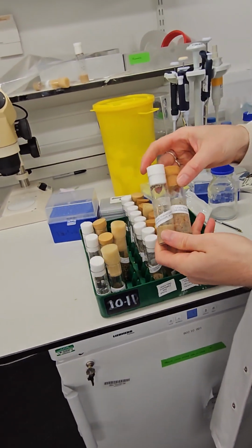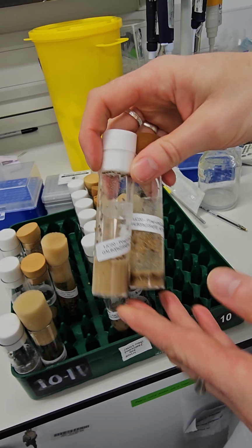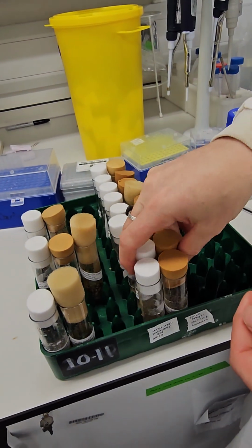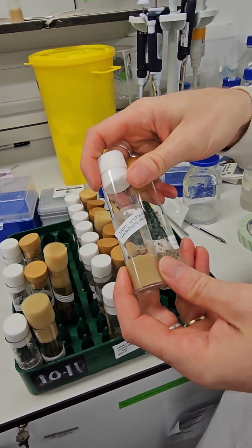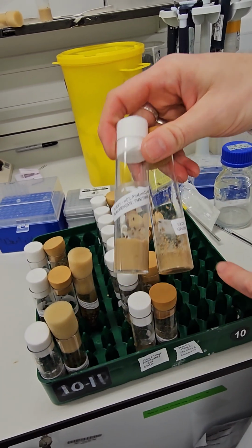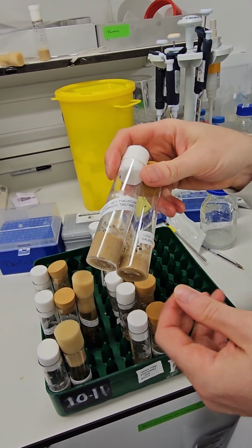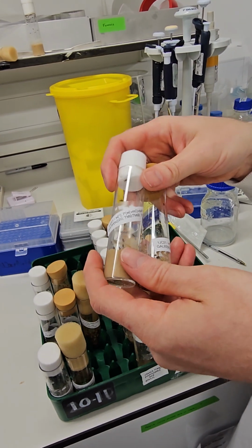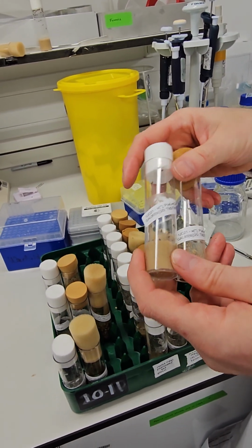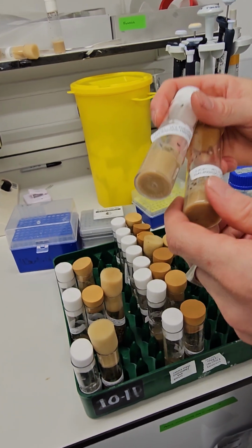The reason why we have these as different labels and different vials is each of those flies is a different genotype. Okay. So each of these has a different little new added piece of DNA stably integrated into their genome. Right. And we want to keep them separate from one another. Yeah. So that we know the genetics of them. Right. So that if we ever want to cross them together, we can do that and we know what we've got.